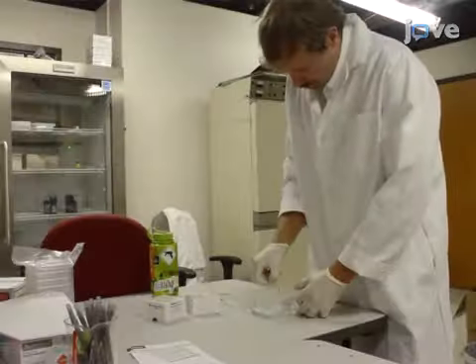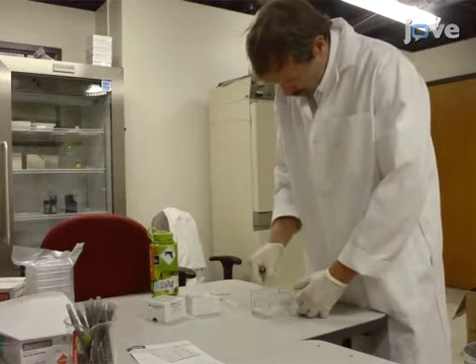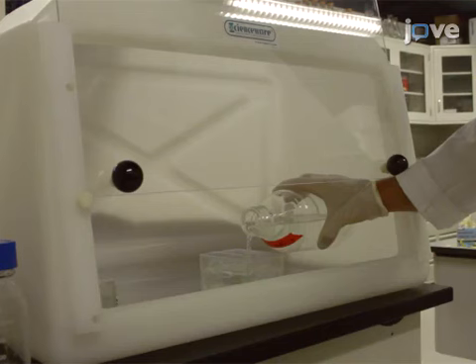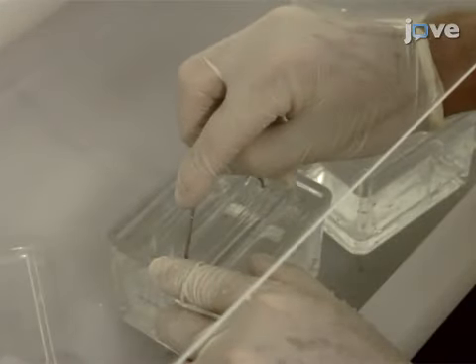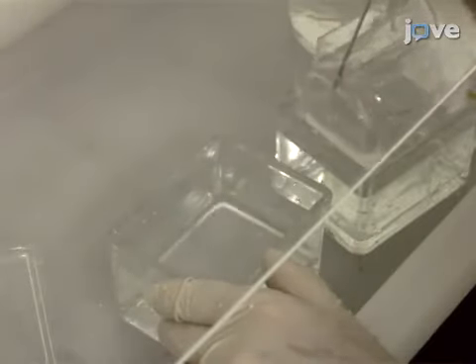To begin, place new glass slides measuring 75 mm by 50 mm by 1 mm into a clean glass slide staining dish. Then, add enough of a 20% sulfuric acid solution to fully immerse the glass slides and incubate them in the acid solution overnight. The following day, wash the slides 3 times by immersing them in fresh deionized water for 5 minutes each time.